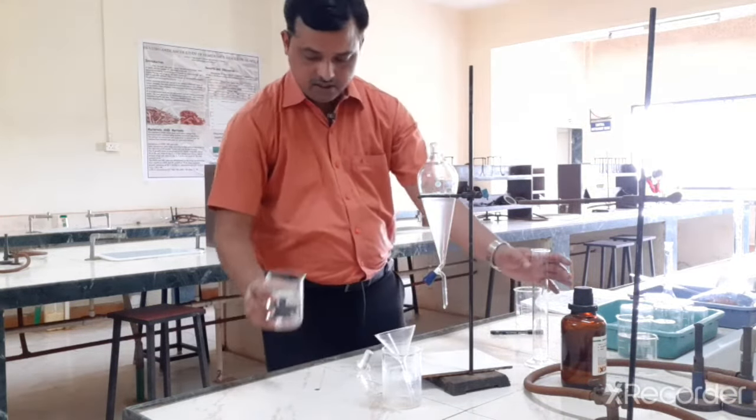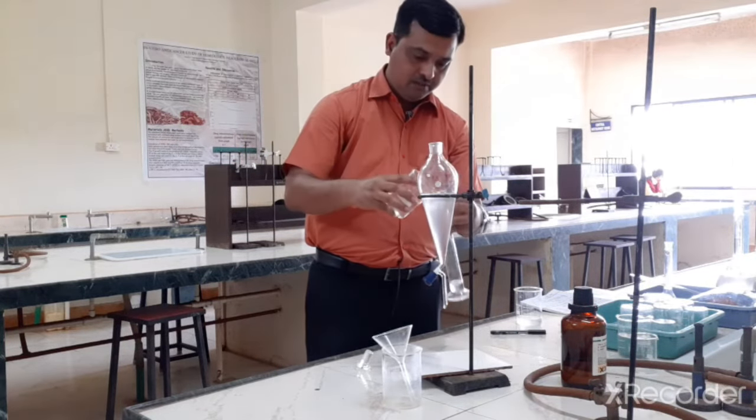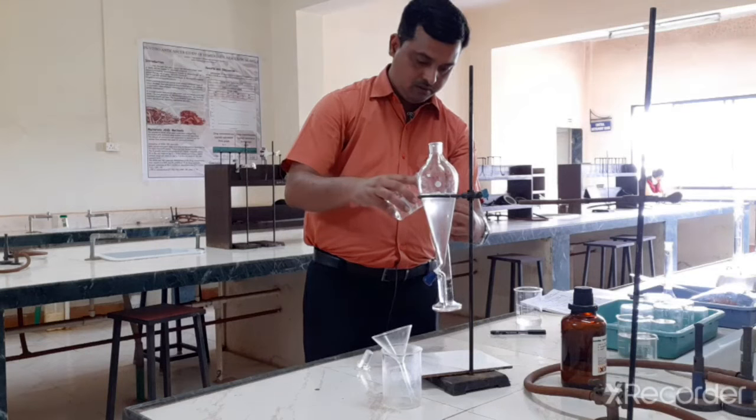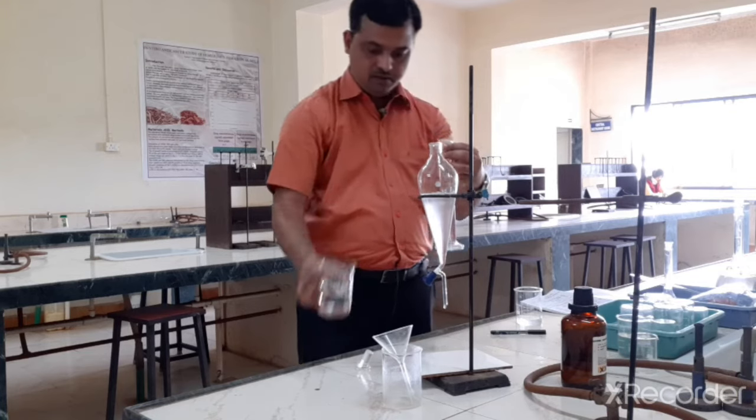So again I need 1 molar acetic acid of 50 ml. Okay.